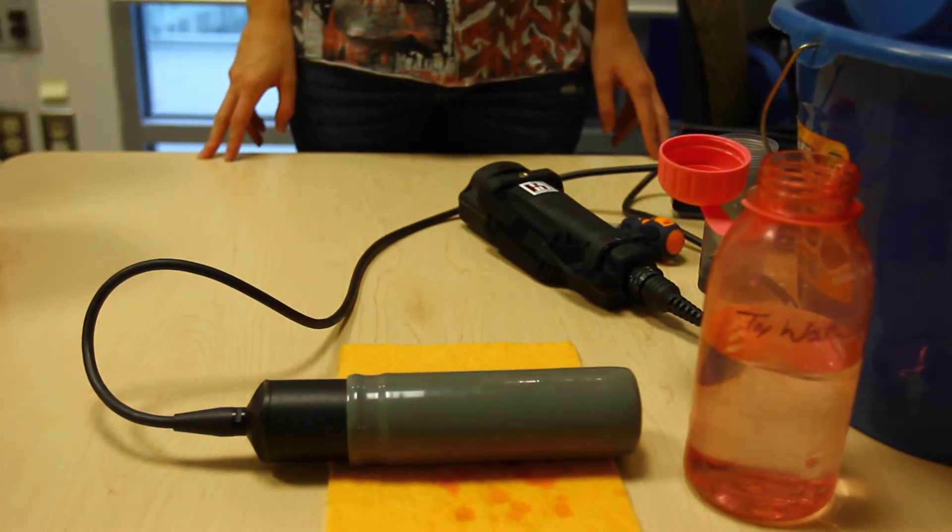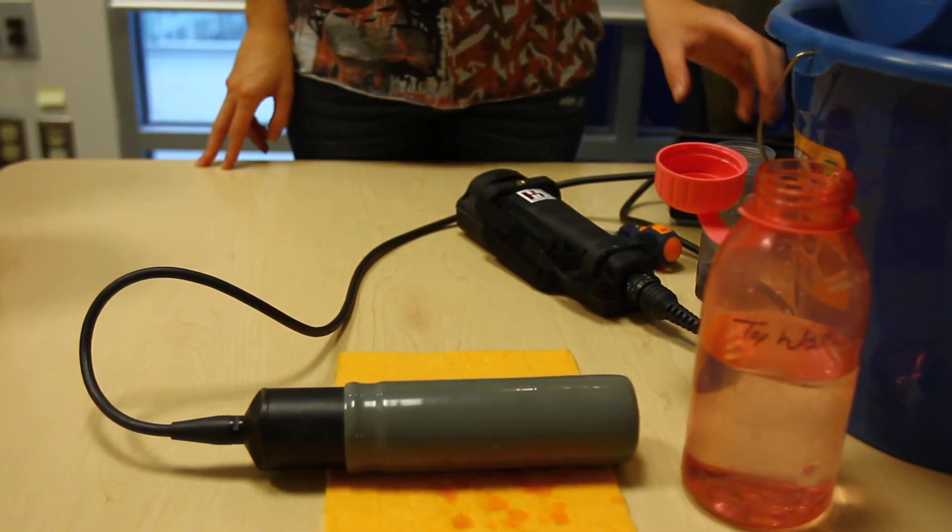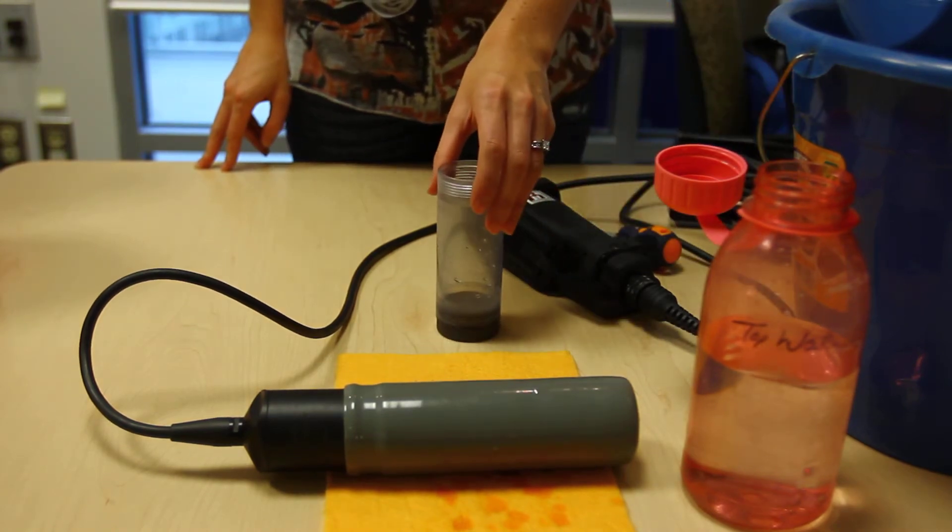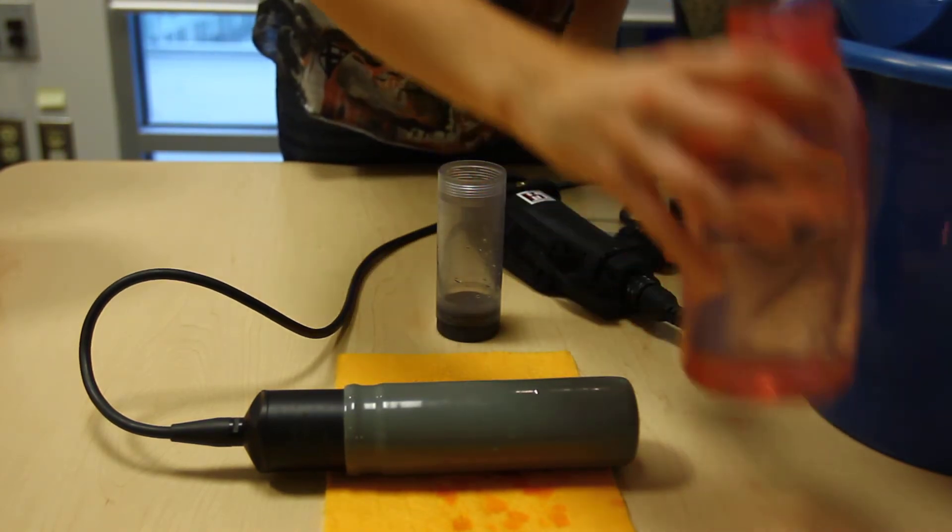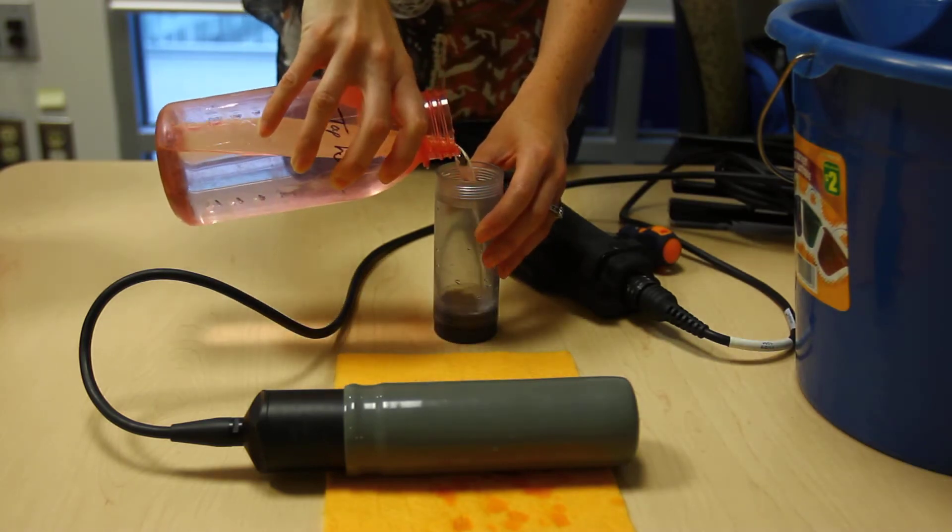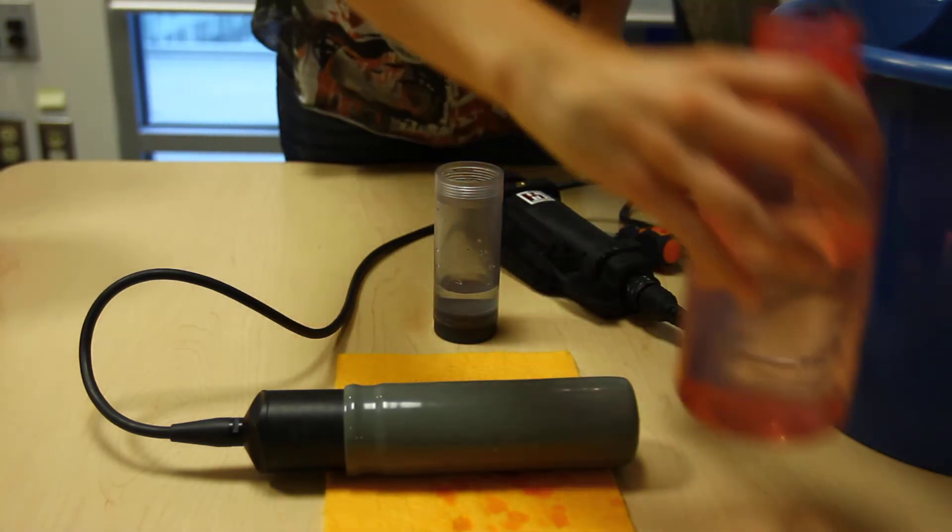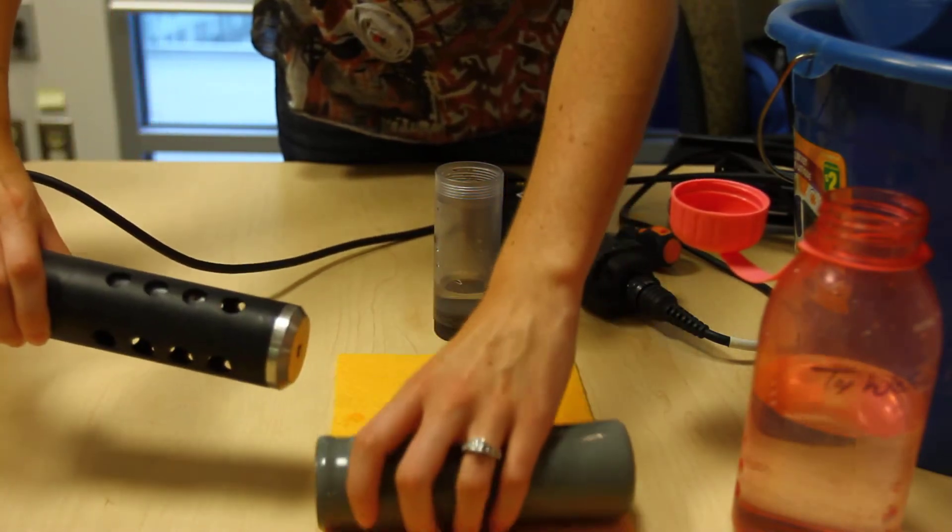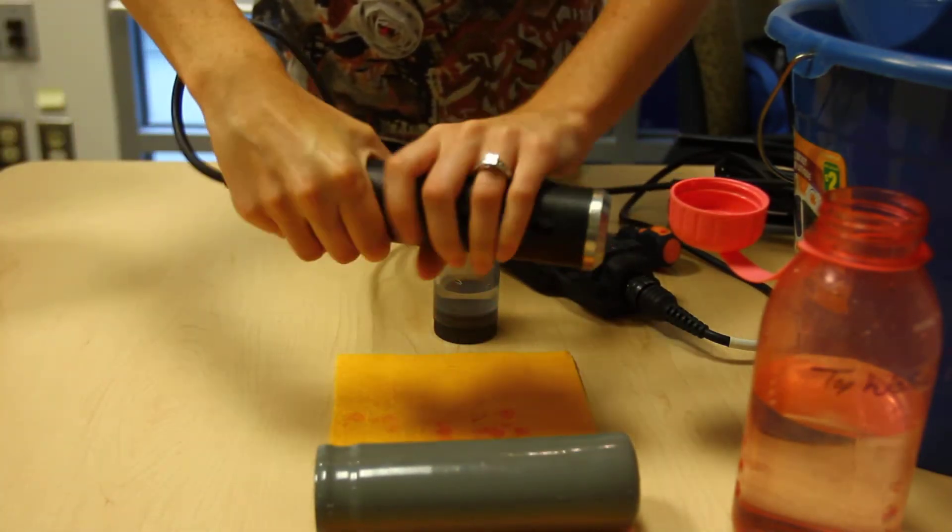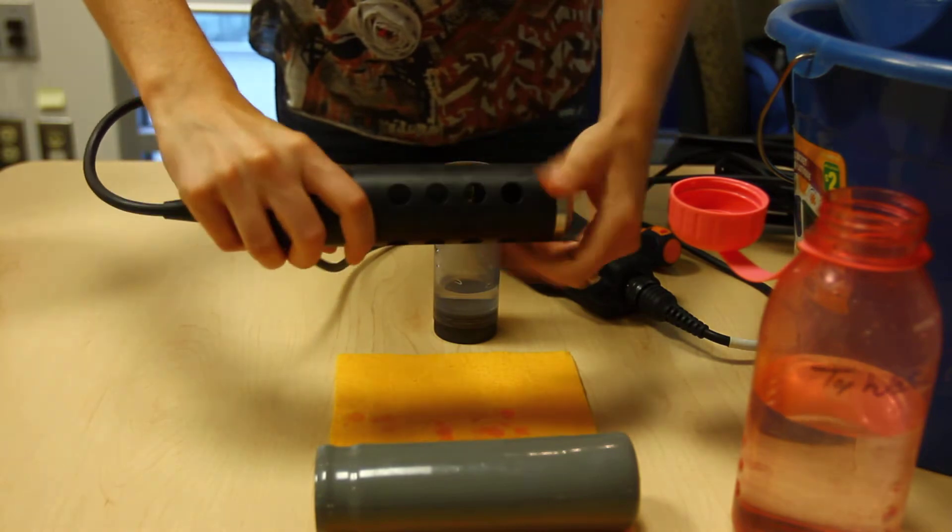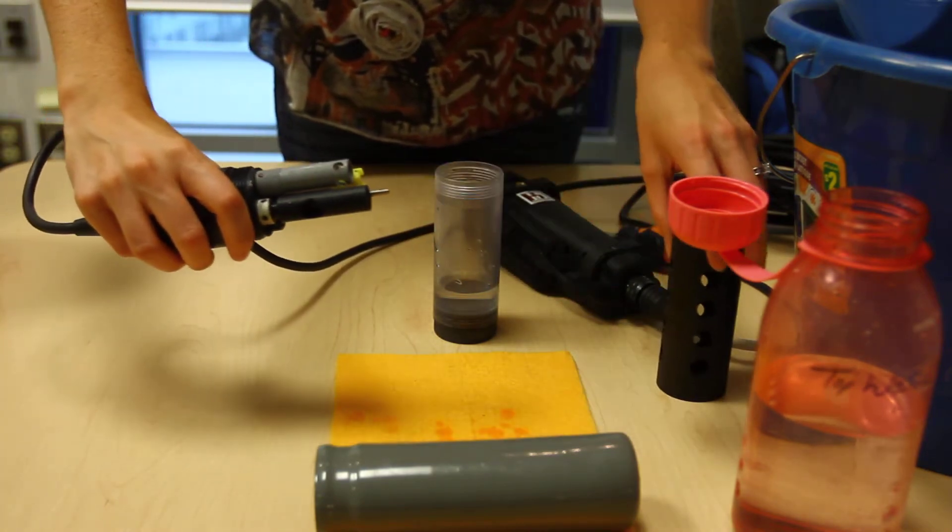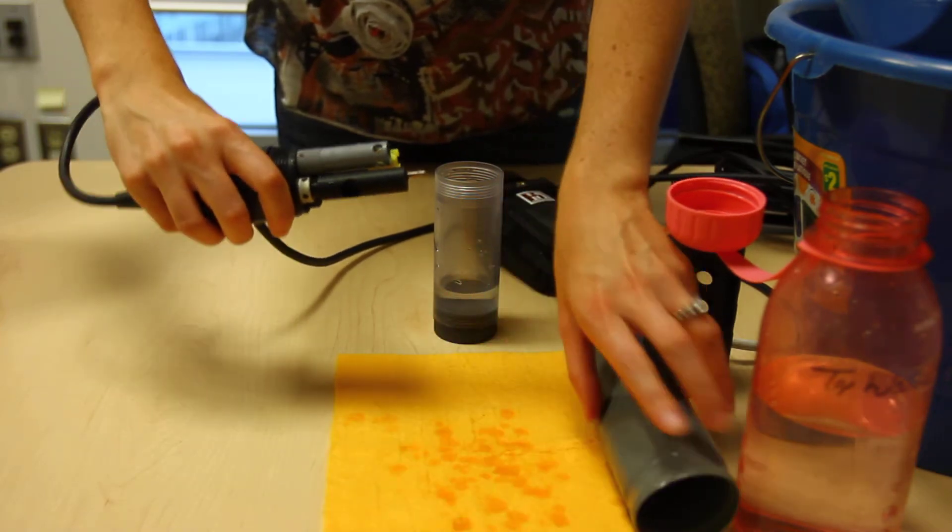If you're sampling between 15 days to 30 days in between, you want to put in a little bit of water in your calibration cup, remove your sensor guard and gray sleeve, and screw on to your calibration cup.